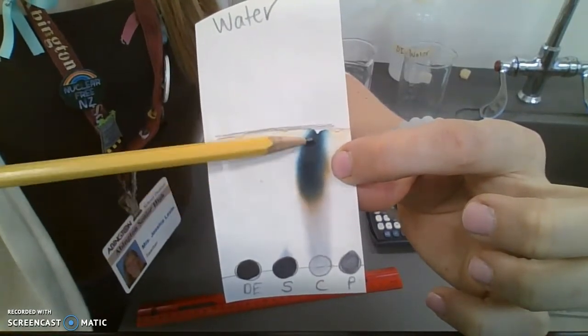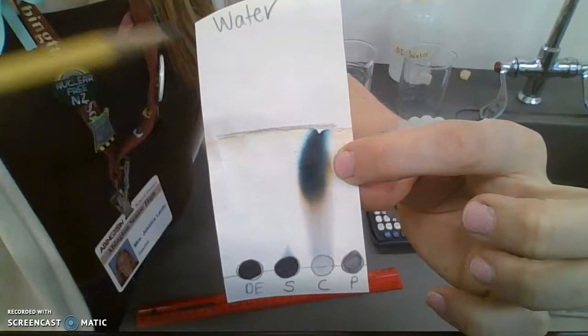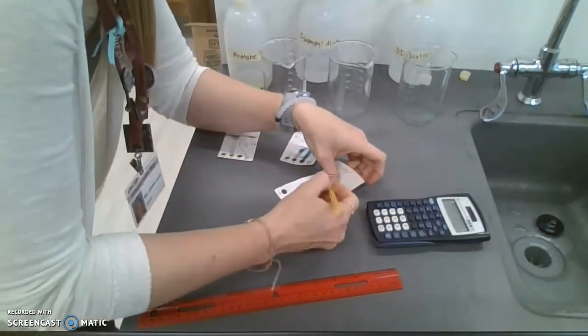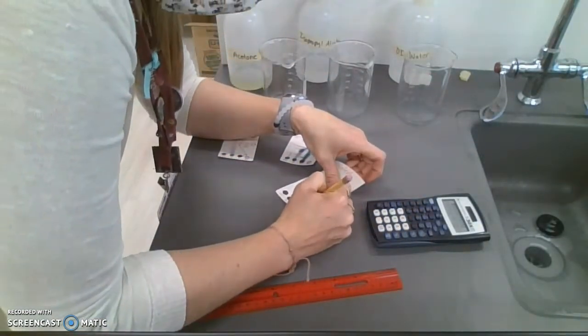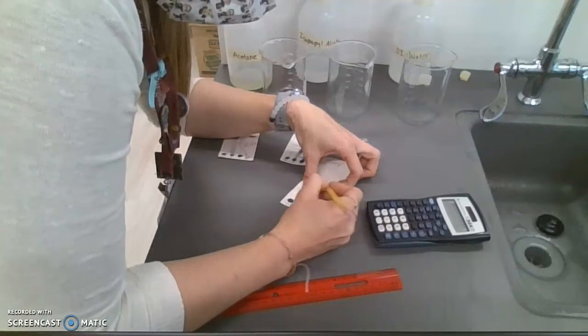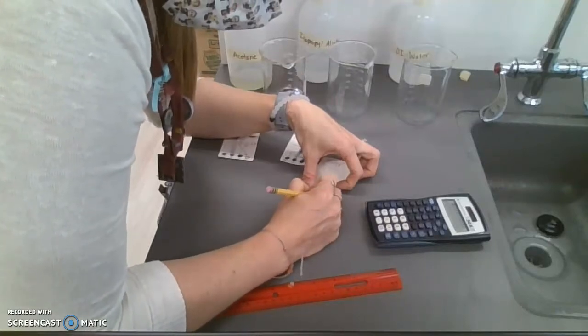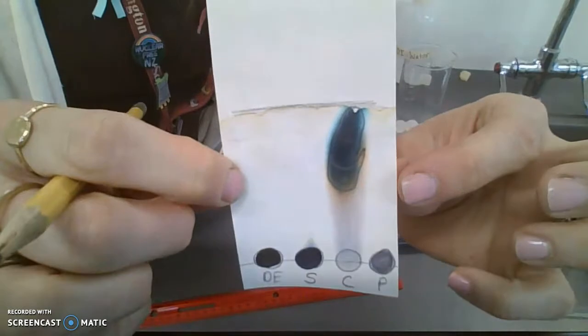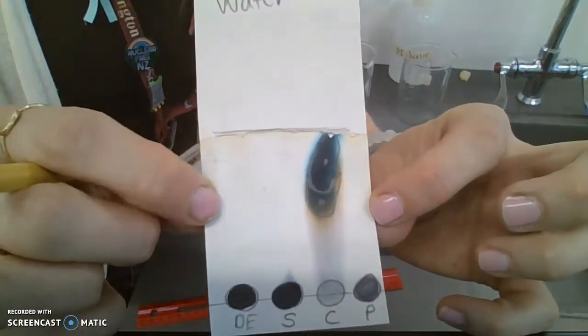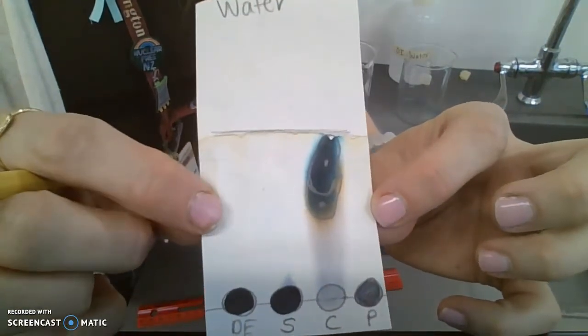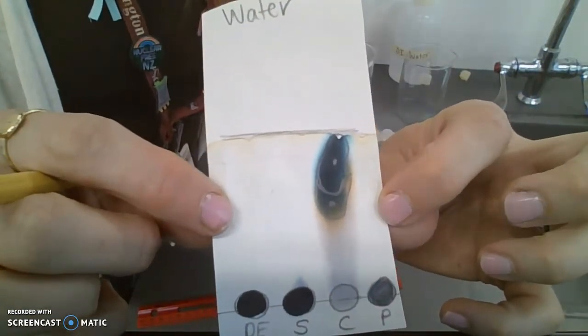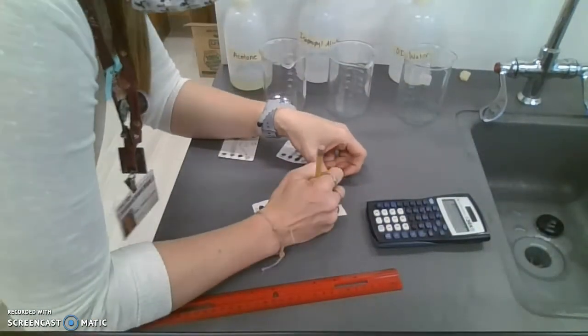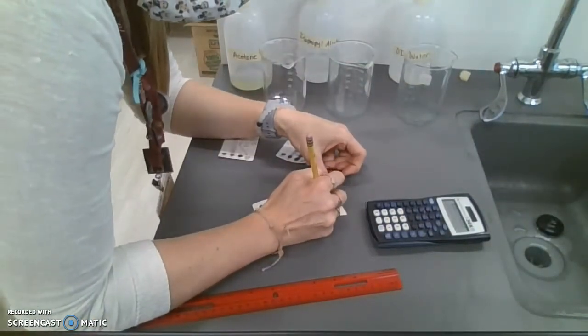So I'm just going to separate this yellow and this dark blue color. There's a yellow teardrop shape like so, and I'm not sure if you can see that - there we go, it's a little glistening part. So I am going to measure the two different distances.